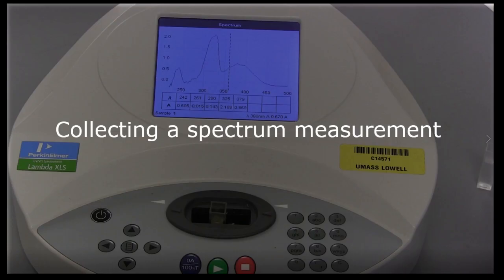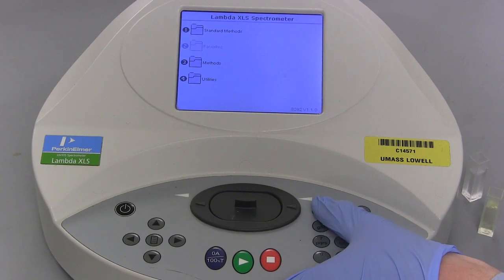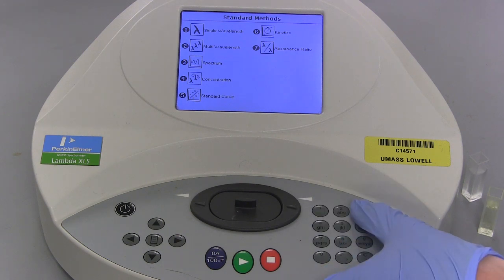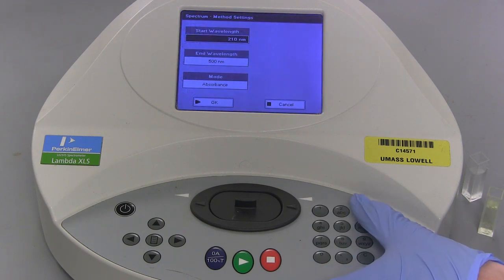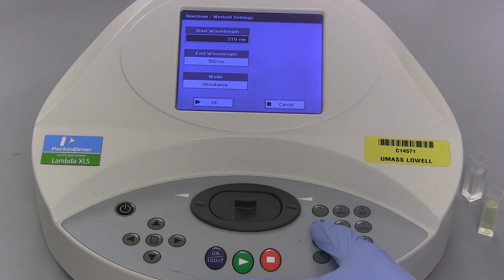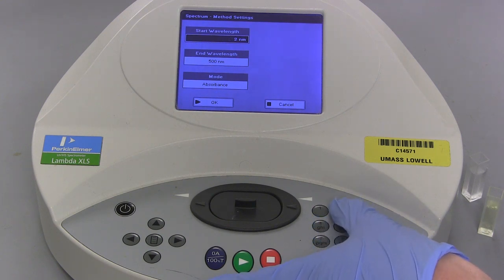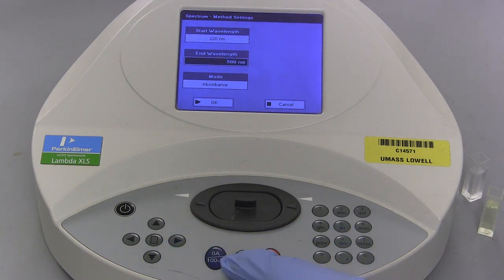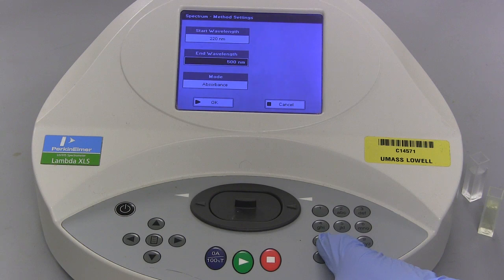This portion of the video will show how to collect a spectrum from your sample. To calibrate, press 1 on the spectrometer screen for the Standard Methods folder. In the Standard Methods folder, press 3 to open the Spectrum Methods settings. Select the start wavelength and with the keypad input 220 nanometers. Press the down arrow key to select the end wavelength and set it to 500 nanometers.